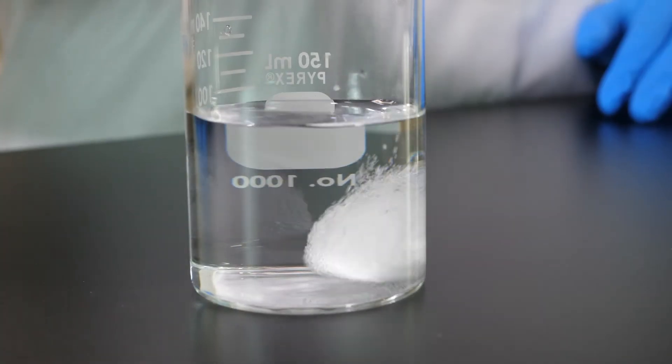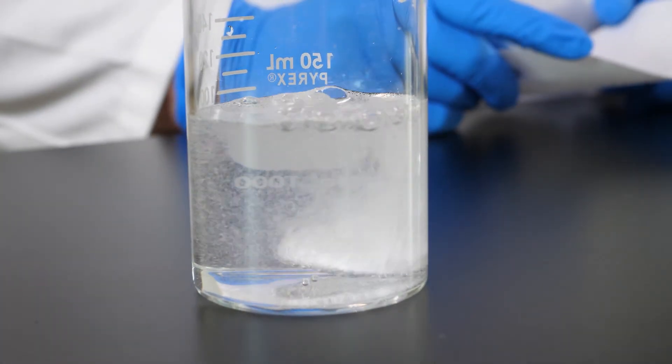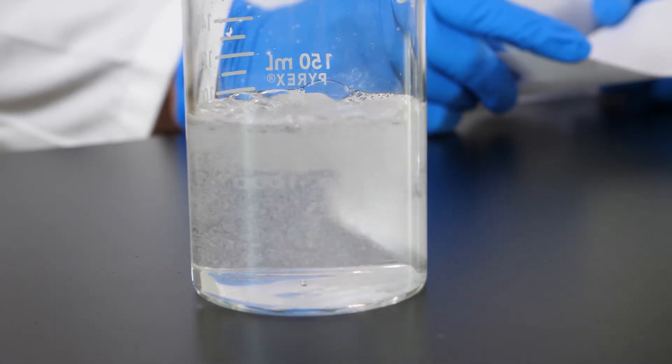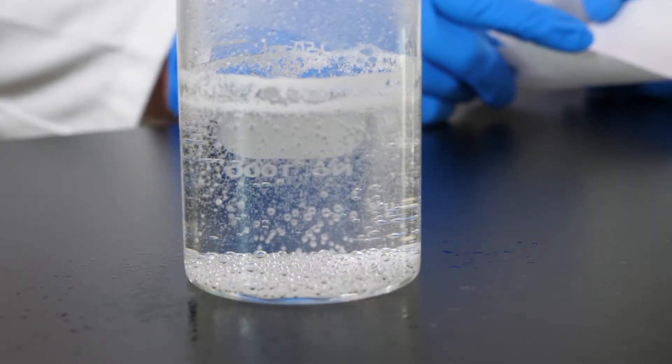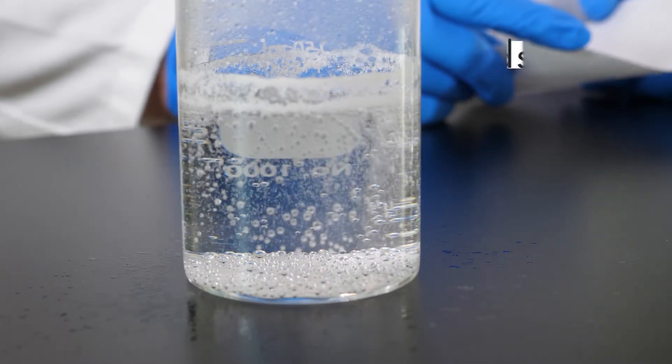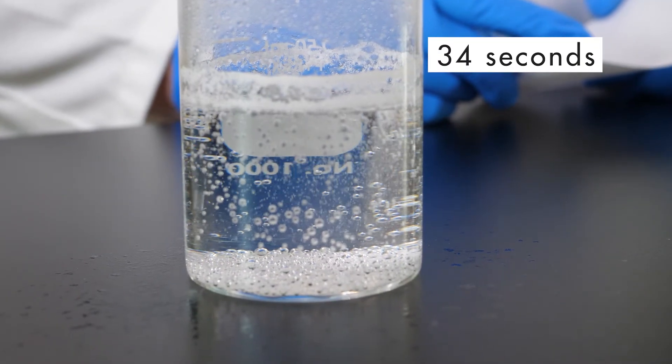We drop the tablet into the water and watch as it dissolves. We see that the tablet dissolves in 34 seconds.